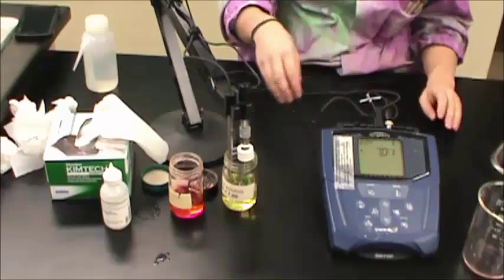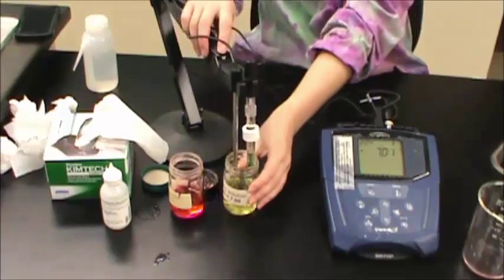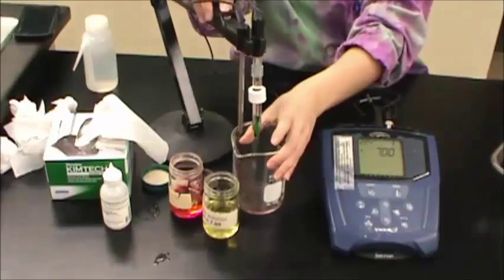The instrument is now calibrated and can be used to analyze samples as needed as long as the probes are rinsed with deionized water and dried between samples.